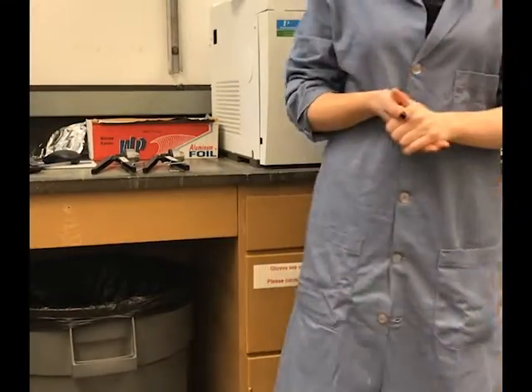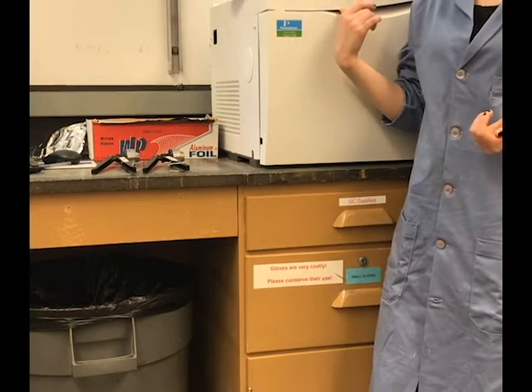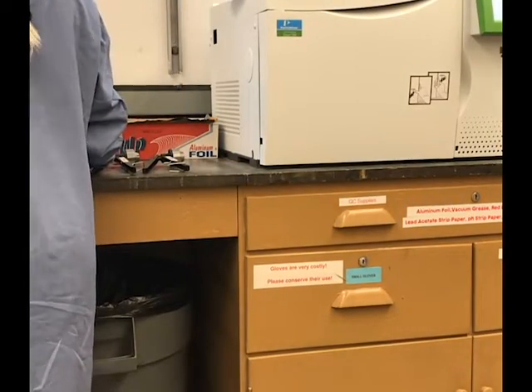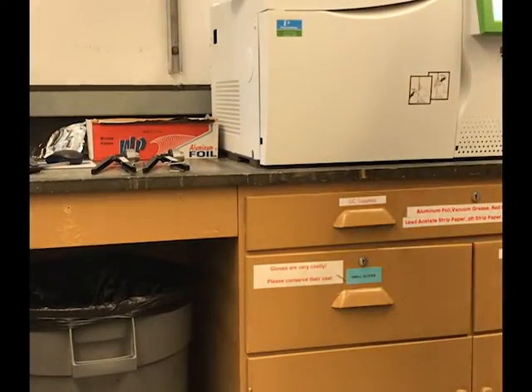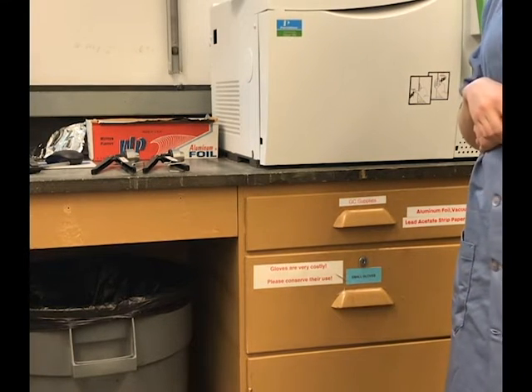Okay, now that we have all of our samples in the instrument and method set up, we're going to go ahead and start analyzing these samples. Just patiently waiting.